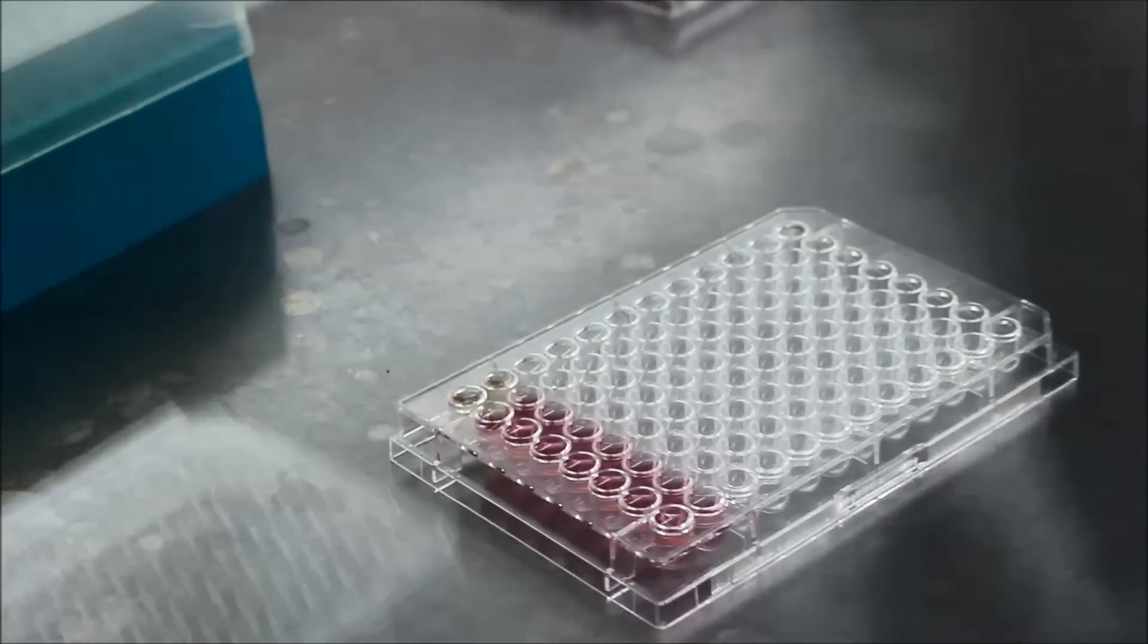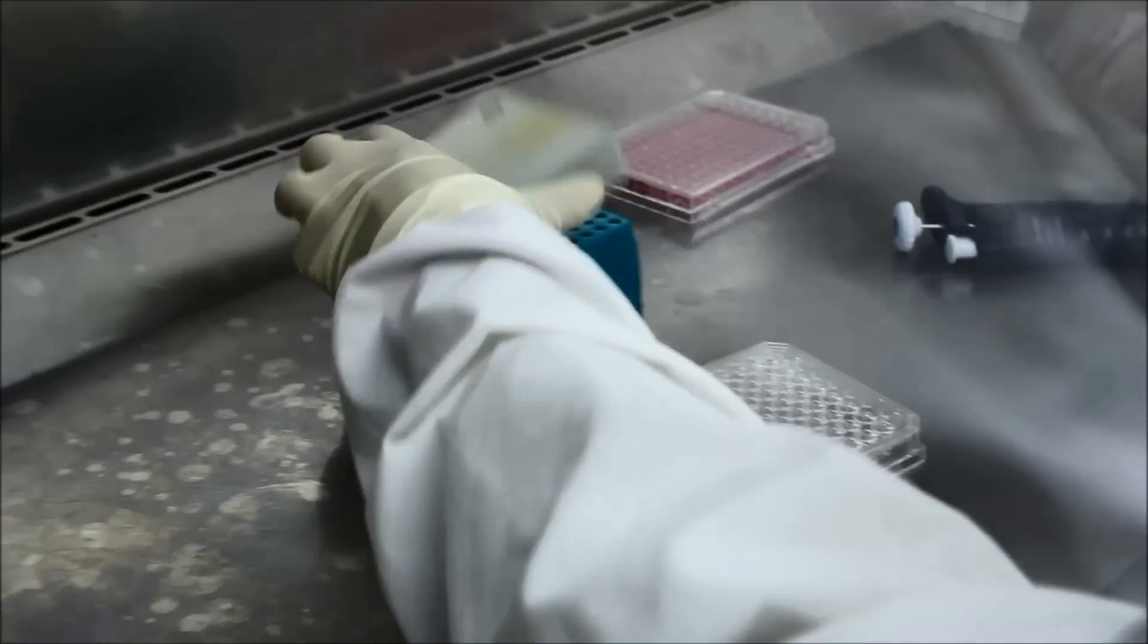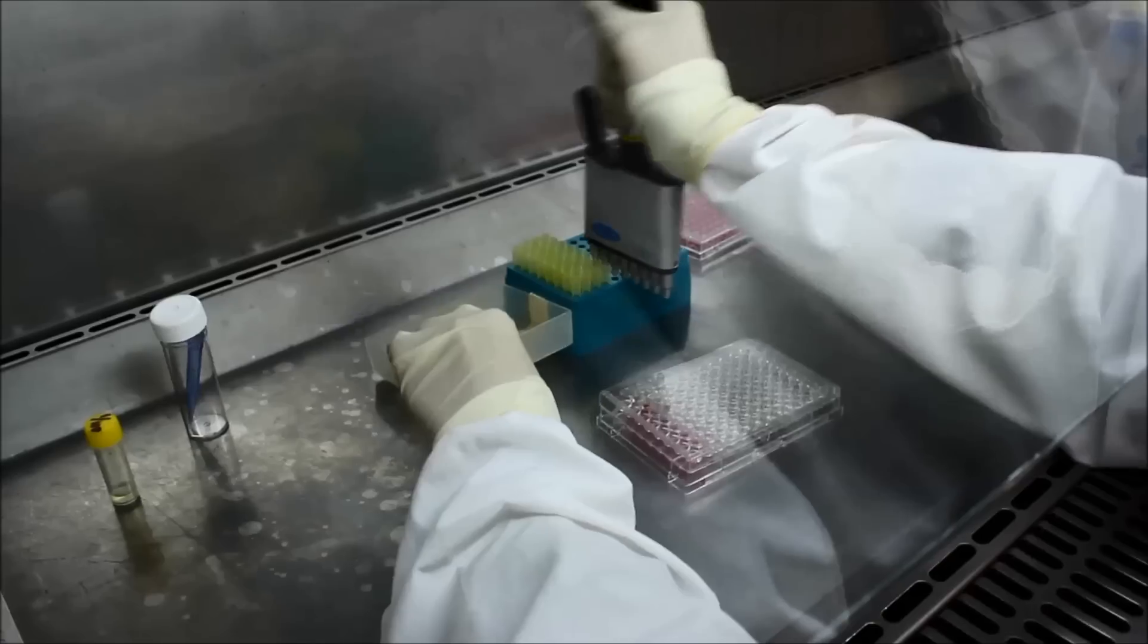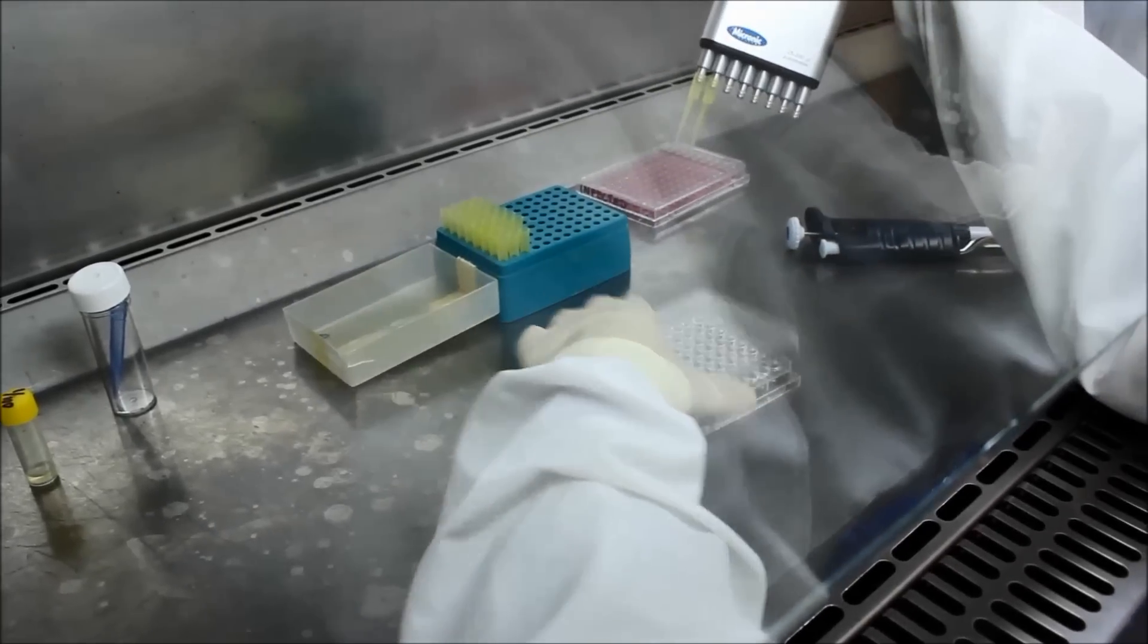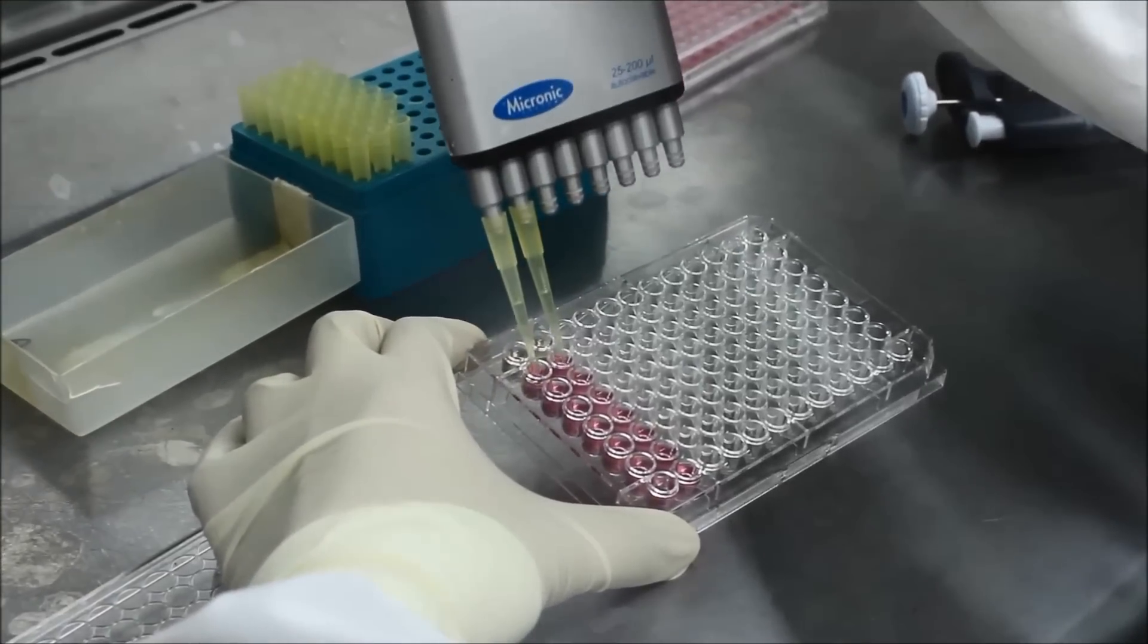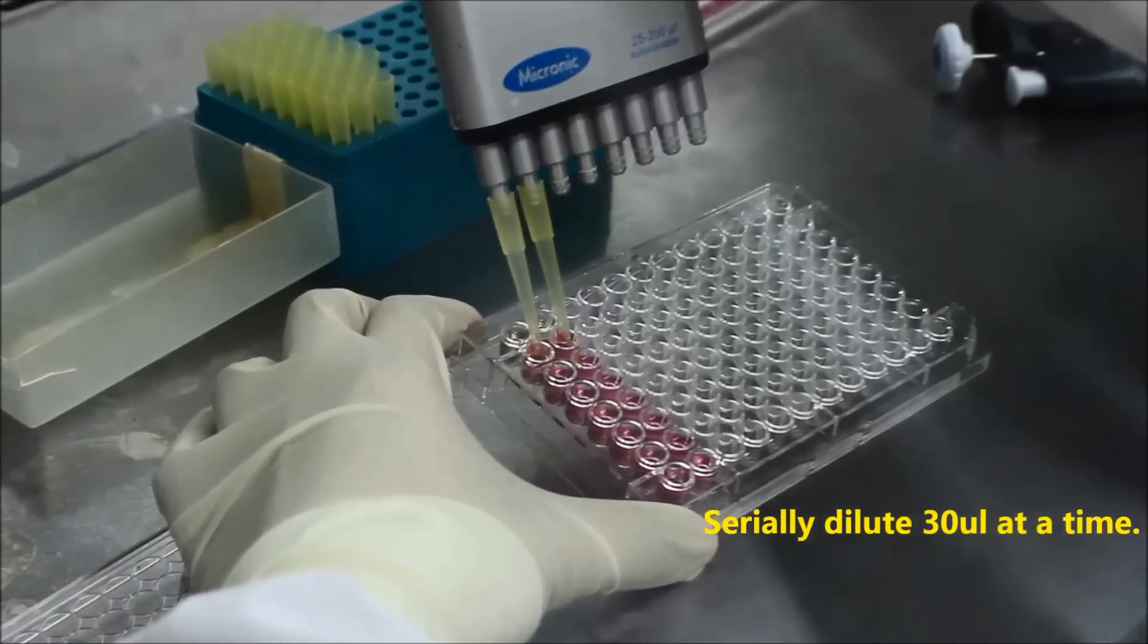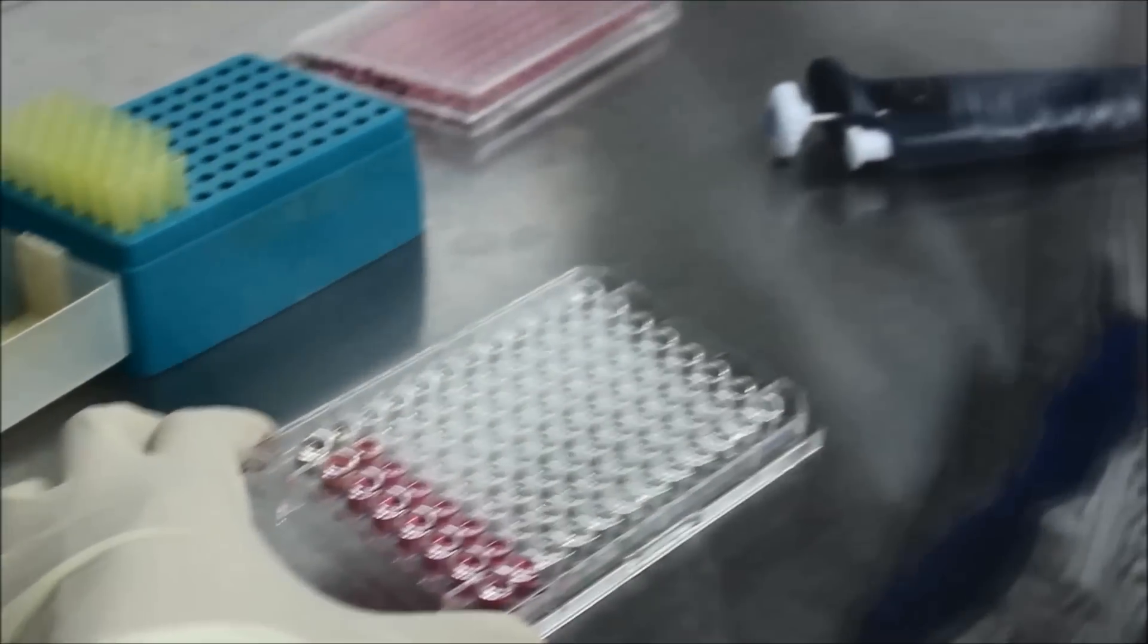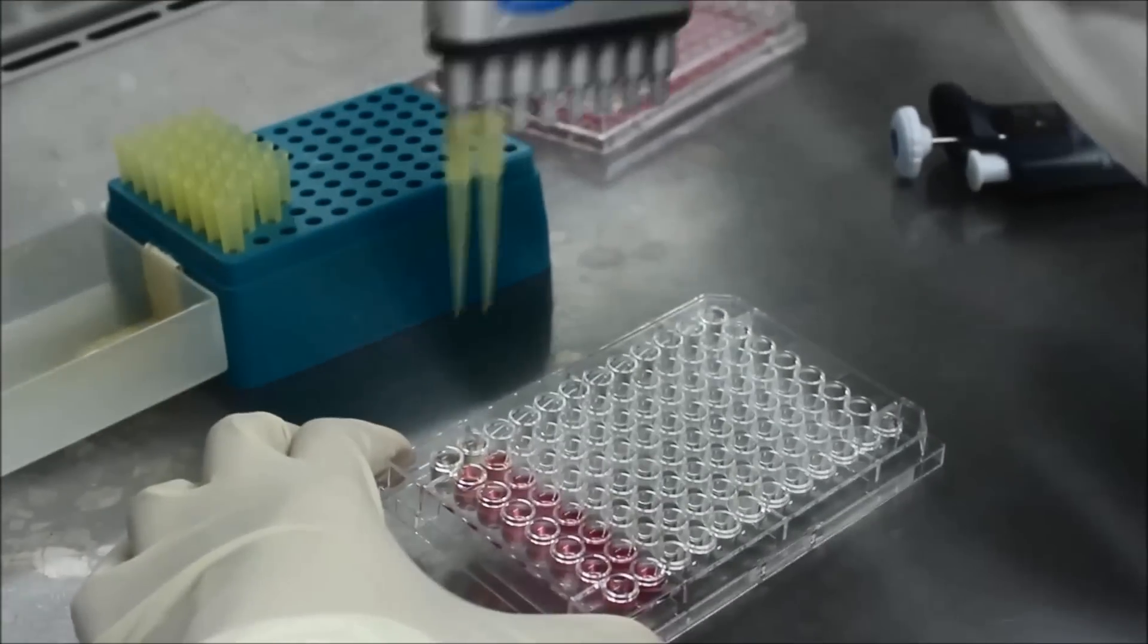This will be serially diluted down the column as shown, transferring 30 µL two wells at a time using your multi-channel pipette. Remember to change tips between dilutions.